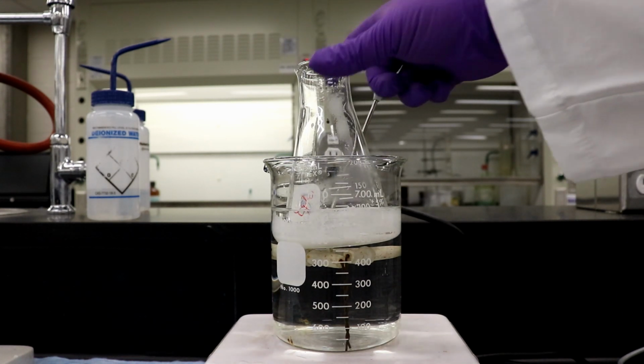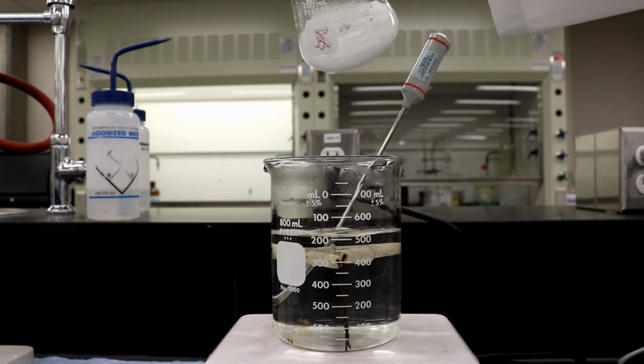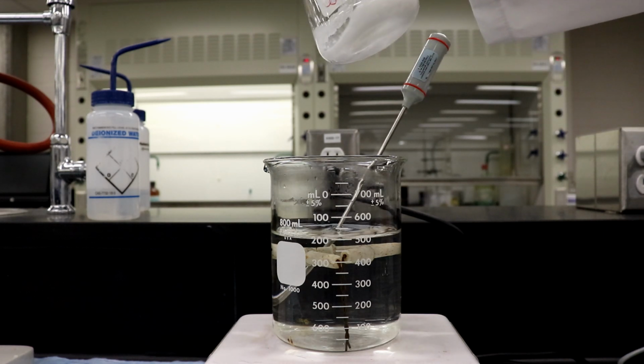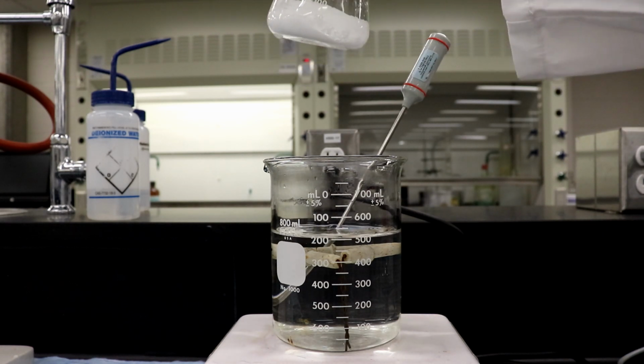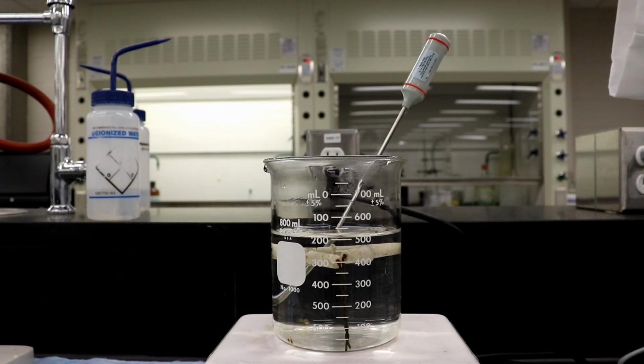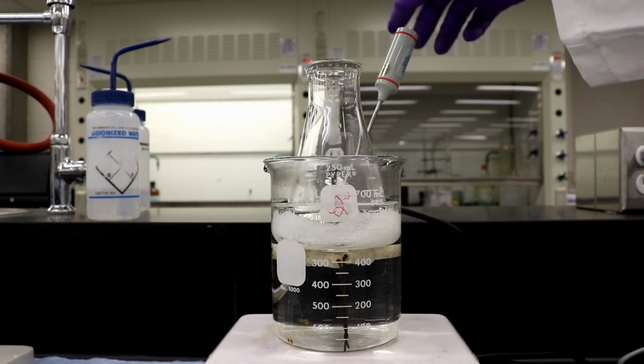Okay, we're at 7 minutes. So, take this guy off now. And we have this big moving gel here now. It's almost a liquid. It's not really crystallized, though. Yeah, I wonder if we have to heat it longer. Maybe we'll put it back in for a little bit more.